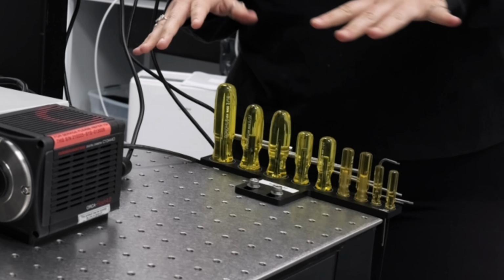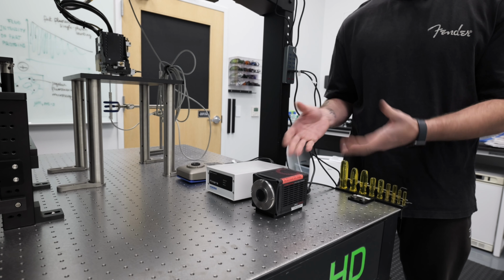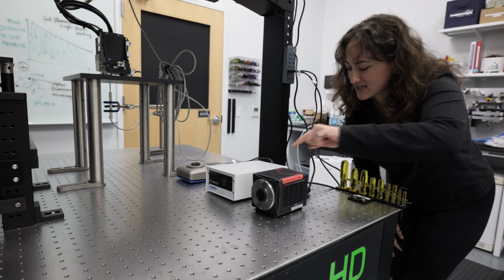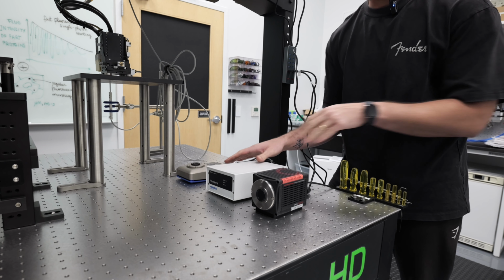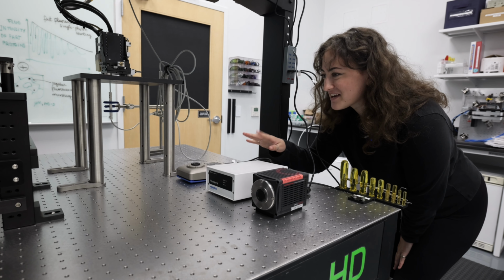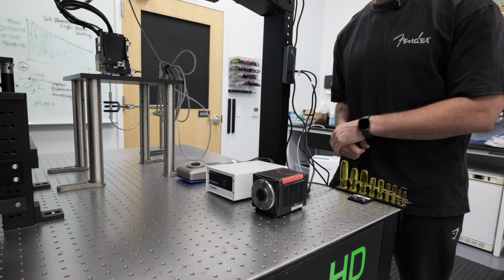Okay, moving away from the screws, we have here a camera for photographing the table. This is actually a camera for photographing biological samples. This is also a camera. This is a single photon detector, and these come together. And that is a photon tool that catches photons, sees photons, hears, breathes, lives photons. This catches photons.